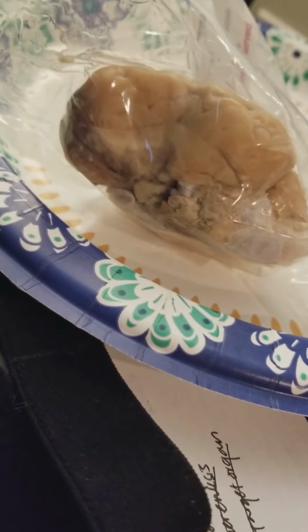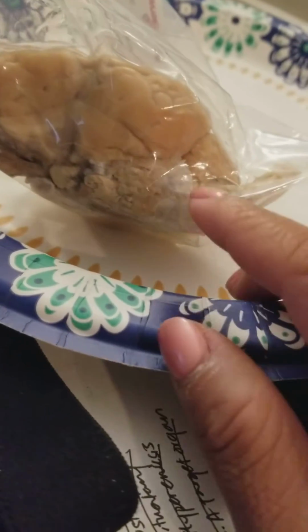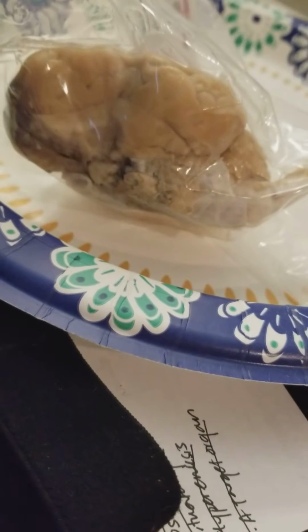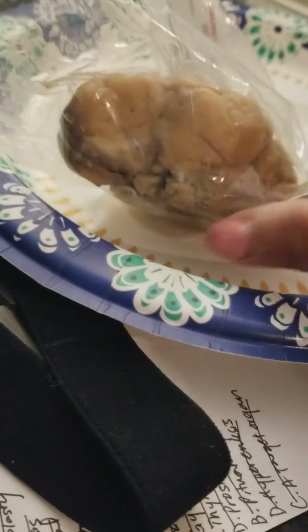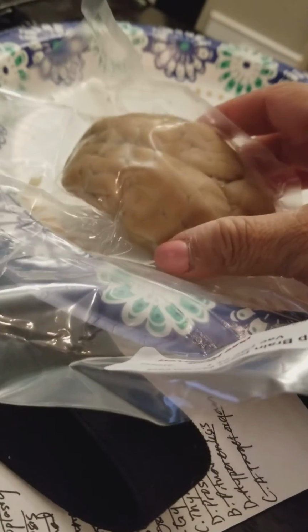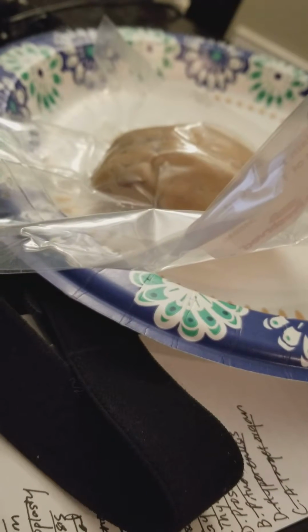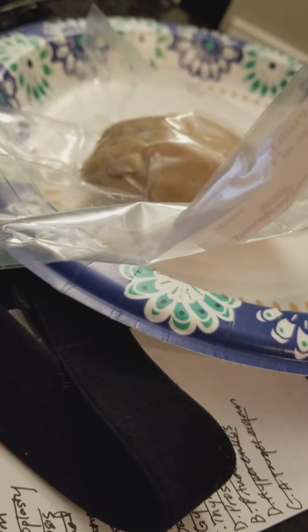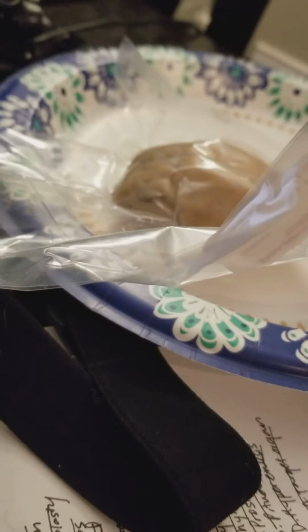The vermis connects the right and left cerebellar hemispheres. It'll be near the cerebellum, which was around this area. Shoots, I forgot where the other ones were. I tried to memorize it, but you have the cerebrum, which is the largest part, and it reads, remembers, and helps with judgment.